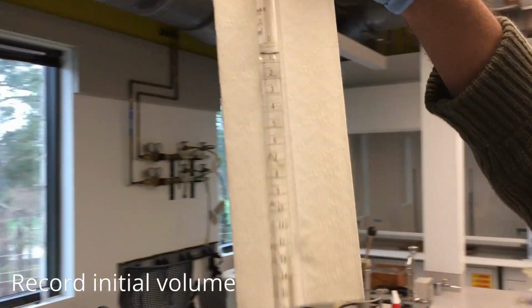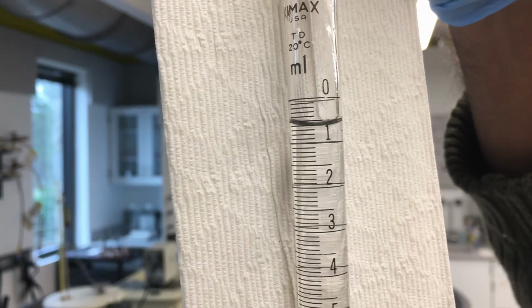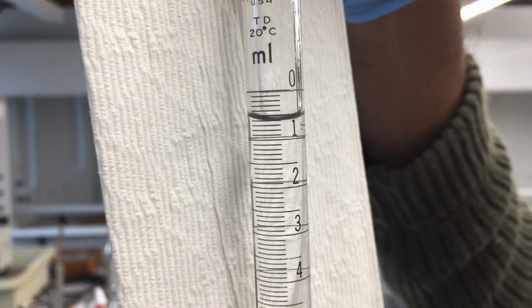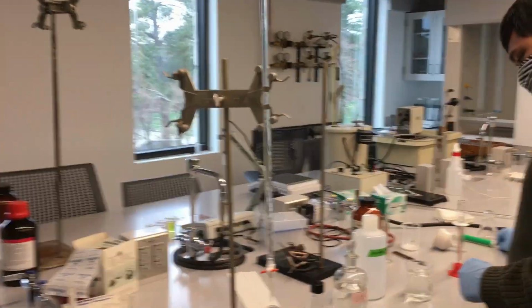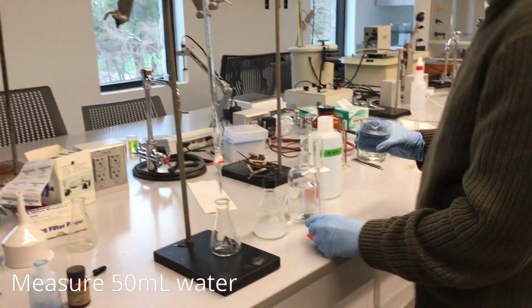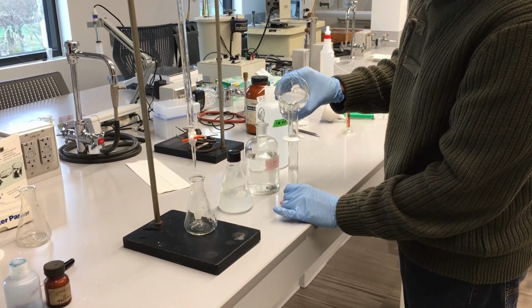So we want to start by recording our initial volume of our burette here. You can see it there. So go ahead and write that down. And now we're going to prepare the calcium hydroxide solution for when we titrate our HCl into it.